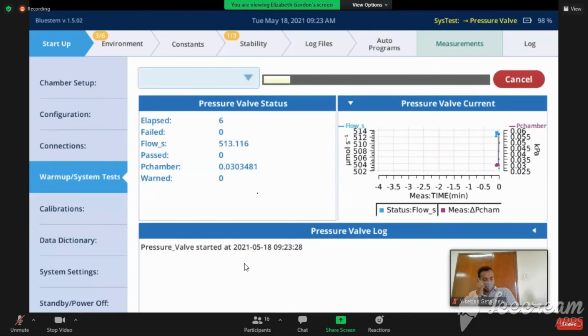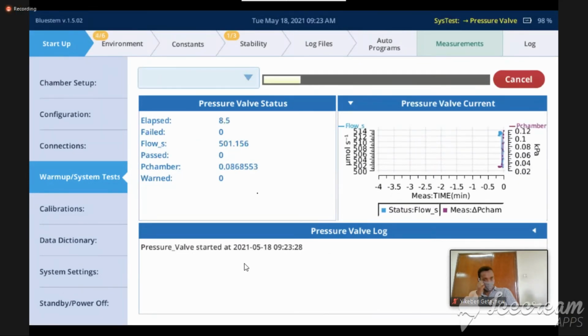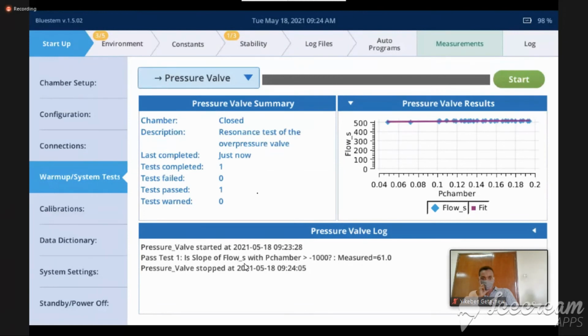So my last test is wobble, and we're just making sure that it doesn't do that. And the reason we want to make sure it doesn't wobble is that we don't want it to do this. If it does this, then obviously that's going to change the way the pressure valve is functioning, and we think we're getting one pressure and we're not. So we're just checking to make sure that there's no wobble in that valve. Just like we're checking to make sure all valves can open and close, we also want to make sure that nothing wobbles. And indeed, nothing wobbled for me, so that's good.